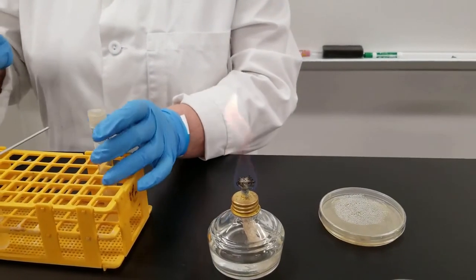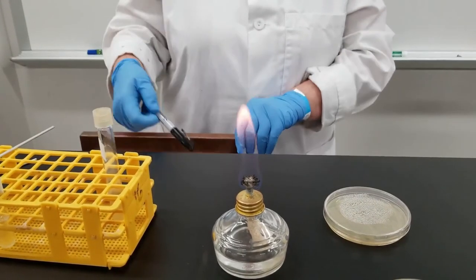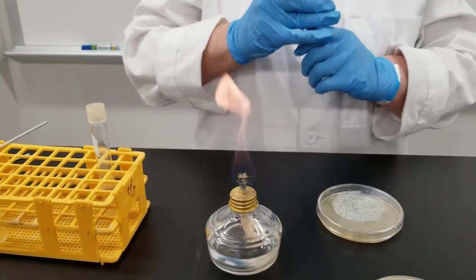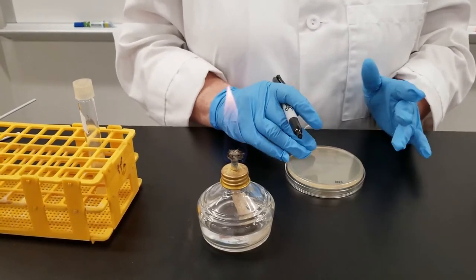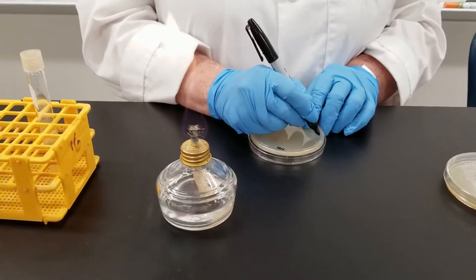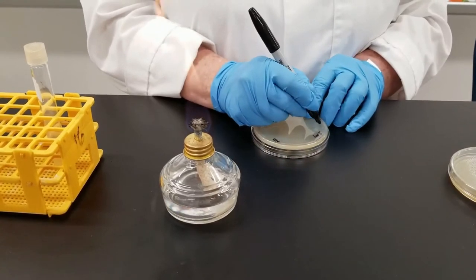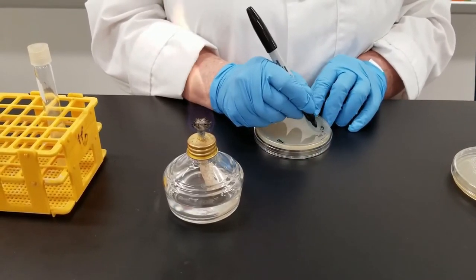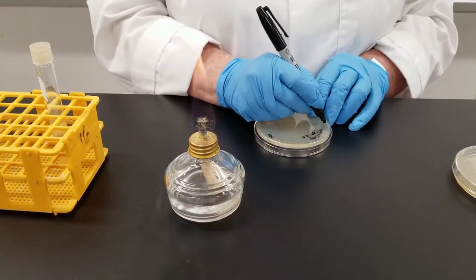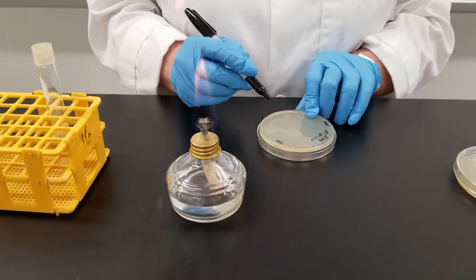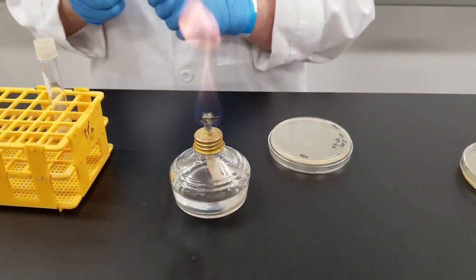Now you're going to want to label everything. Some people will label with tape. Some people will label with a sharpie. I recommend if you're labeling with a sharpie on a petri dish, label it on the bottom. Just in case something were to happen and the lid would come off. You don't know what's grown on that plate. So in this case, I'm labeling it with the initials of the organism. We use Serratia marcescens. I will put today's date on there. I am also going to put my initials on here. So if anybody has a question, they know who inoculated it. The initials up here, NA, stand for the media. So we know that it is a nutrient agar.